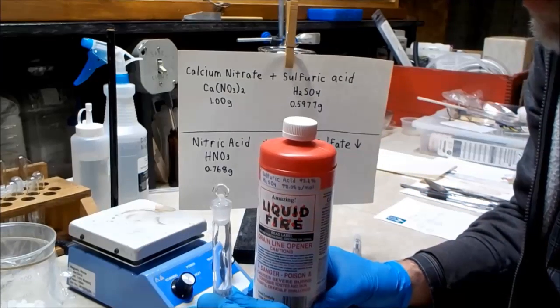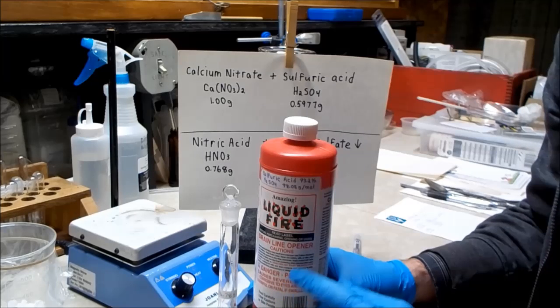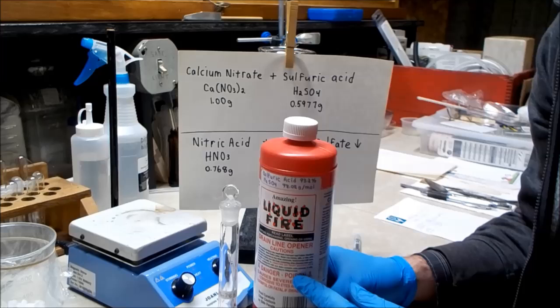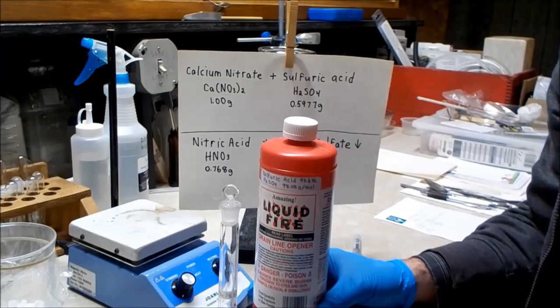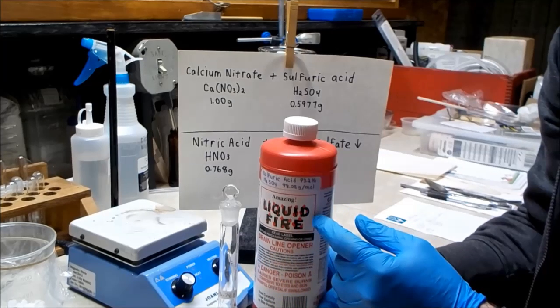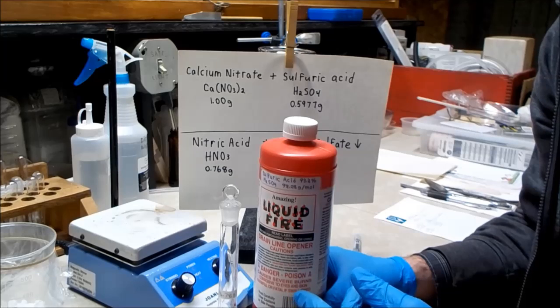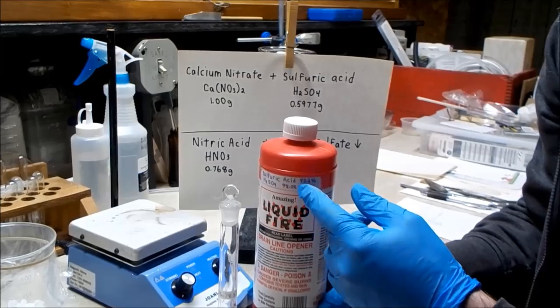The way I'll do that is I'll use this volumetric flask to measure its density. Online I found a table that shows the density versus percentage of sulfuric acid. I'll measure the dry weight of the flask, then fill it up to the reference line with my sulfuric acid, then weigh the entire thing, and I can calculate the density, look it up on the table, and see what the strength is. Hopefully these numbers will be in close agreement.